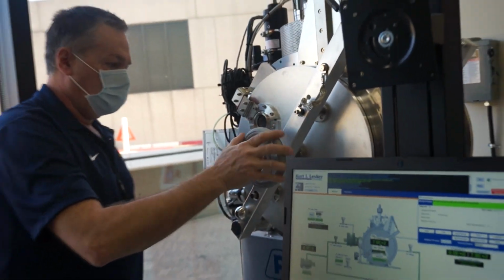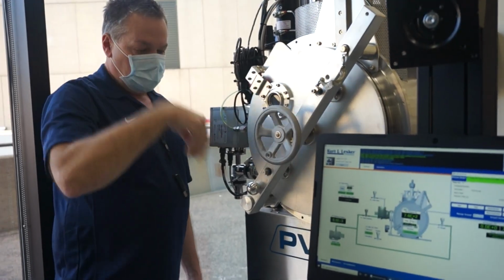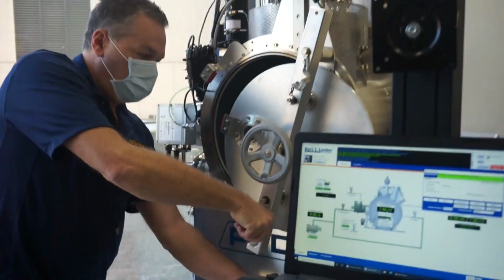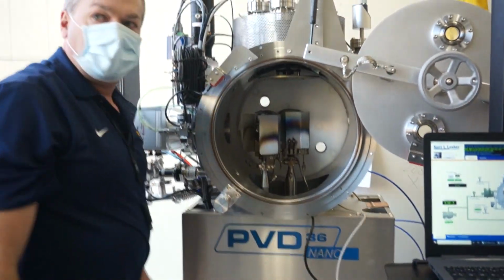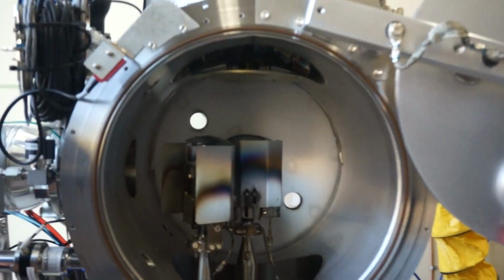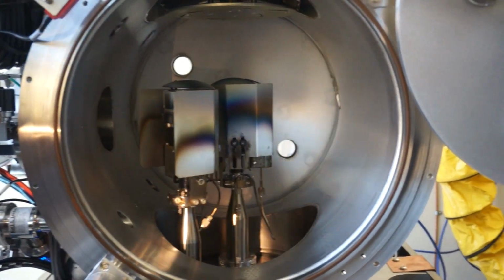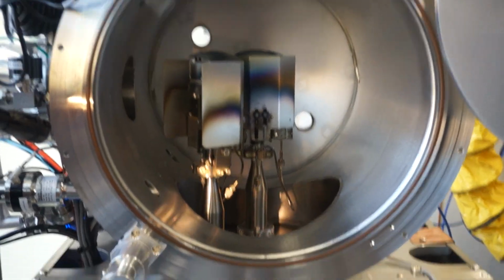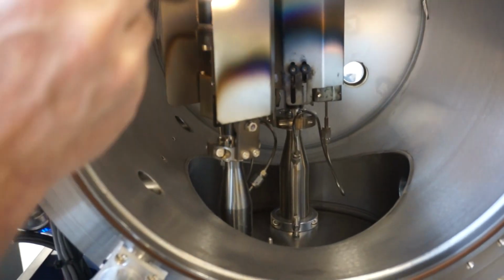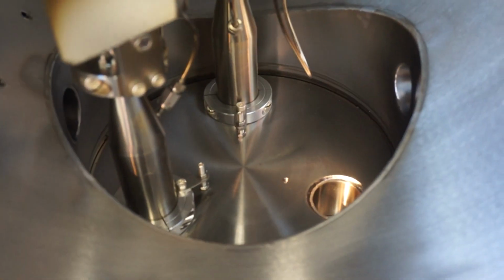I just need to open it up enough, and then swing it out of the way. Right here? Okay. Yeah, sorry, we're bumping the walls in here. So you have 2 guns within this tool, source 1 and source 2. You have a 3-gun base plate. You'll notice there's another hole over here.